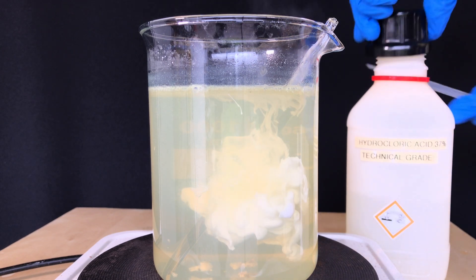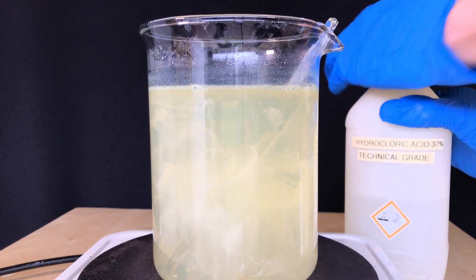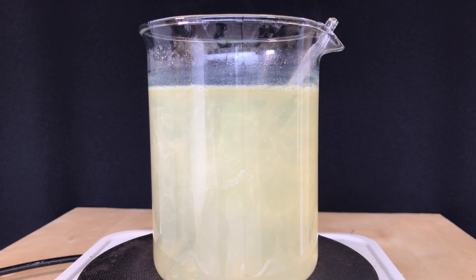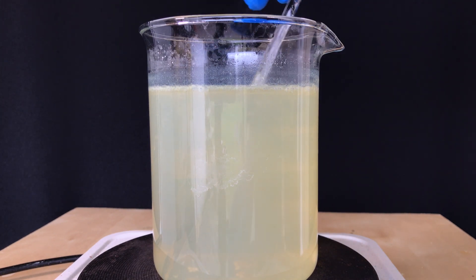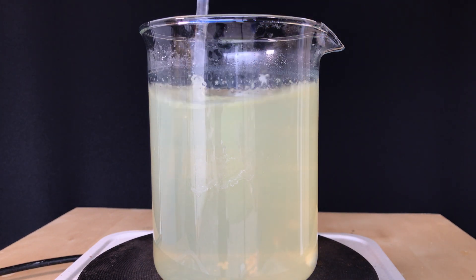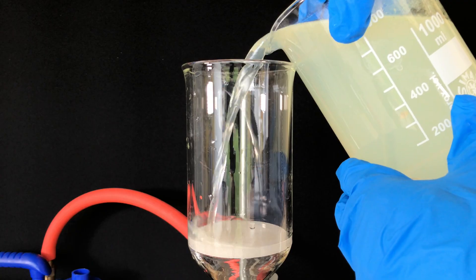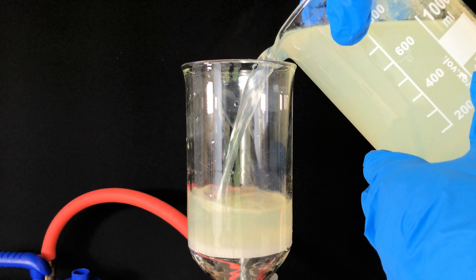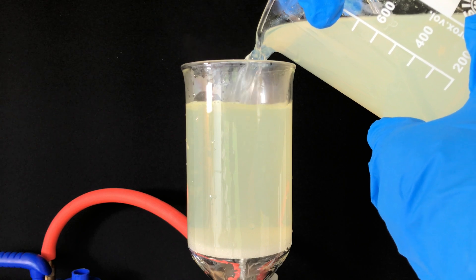I don't know why exactly, but my paper called for adding about one milliliter of hydrochloric acid to precipitate some insoluble oil, but I guess this didn't happen in our case. I guess adding hydrochloric acid was unnecessary. To get rid of benzil and other insoluble contaminants, another filtration was performed while hot.